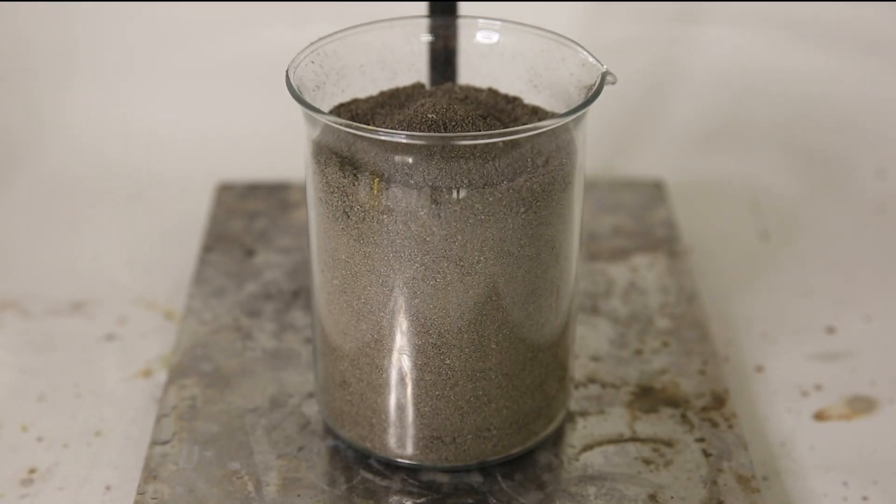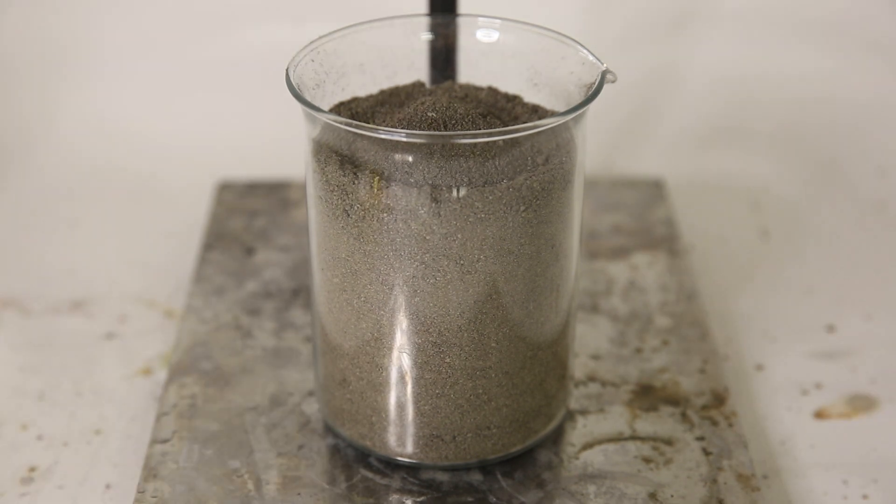So now that everything is out, I want to convert the silver gluconate to something I can work with. Right now it contains a lot of carbon, which would take a lot of effort to incinerate and would make a big mess, so I'm going to remove it.